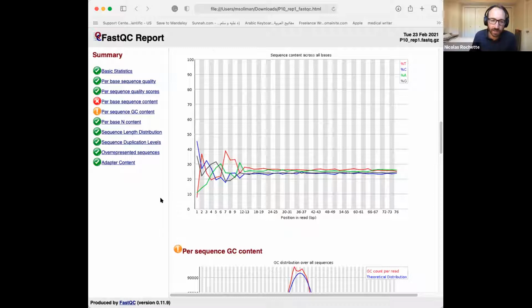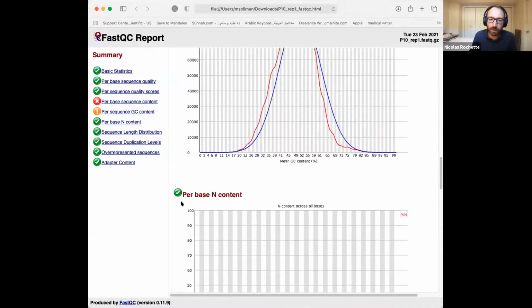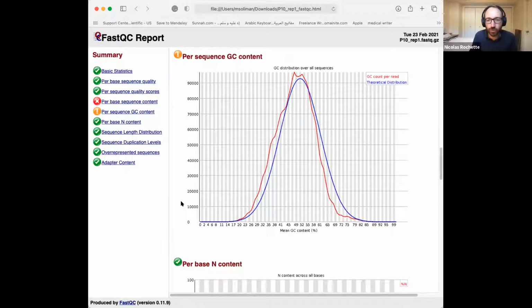In general, what this suggests, and that's also something the next graph shows, is that if we have peaks at weird places in the next graph, that can be due to ribosomal RNA contamination. If we see big peaks here, it's because ribosomal RNA is single-stranded, it's always the same sequence, and it's so abundant. Because it's single-stranded, we don't have this property that the A and T should be more or less the same. Genes are also single-stranded, but overall they average out. Whereas ribosomal RNA, as a single highly abundant species, tends to create problems. So if this graph is really bad, sometimes you see multiple peaks and very weird spiky things. That can be an indication that there is ribosomal RNA contamination.